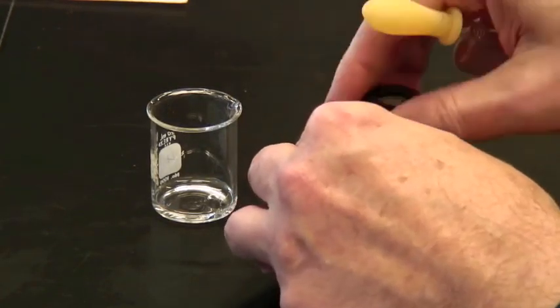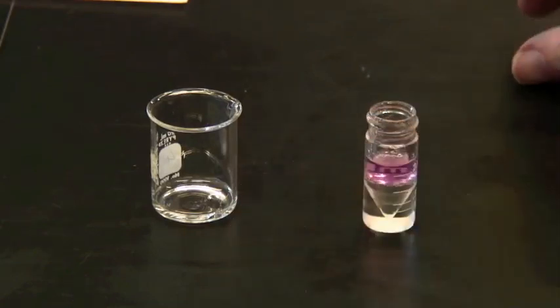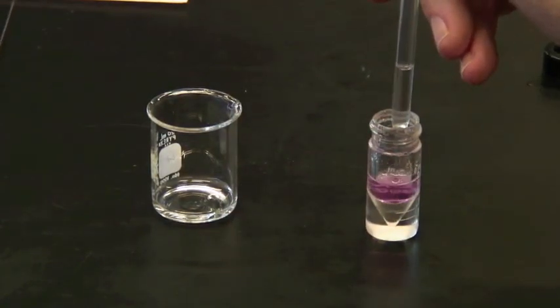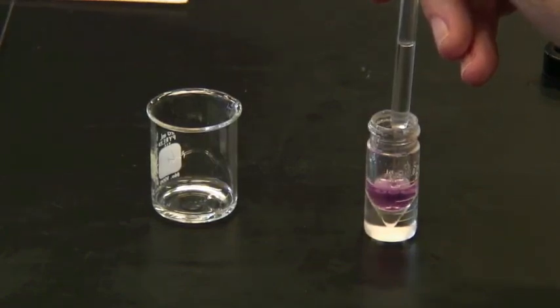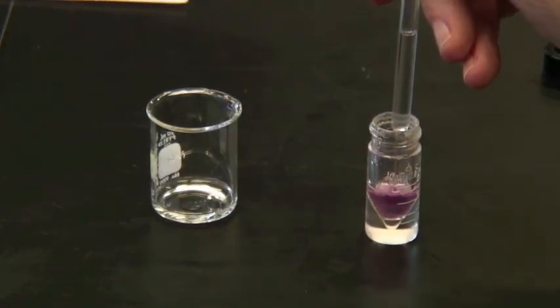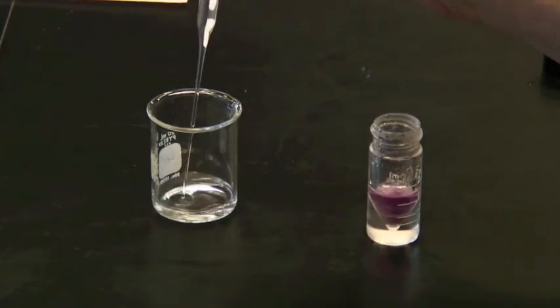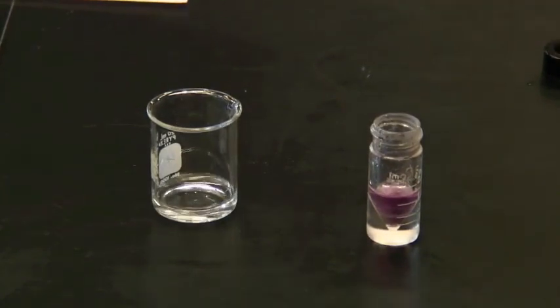In this case, that's the aqueous phase. Don't worry if you get just a couple of drops of organic in with you. That's not too much of a problem.